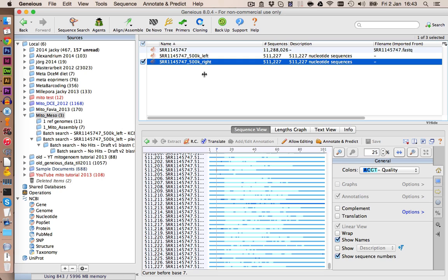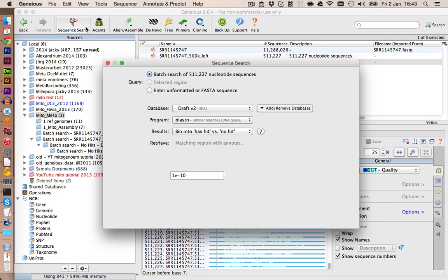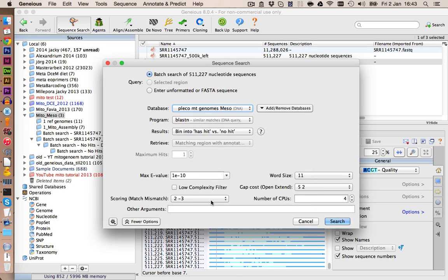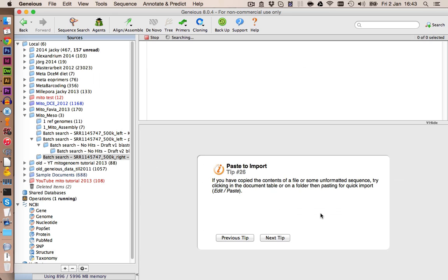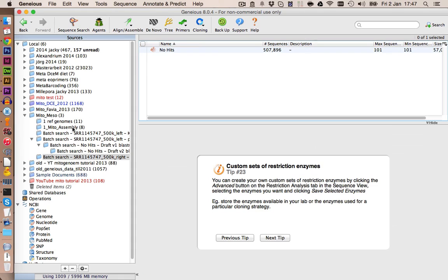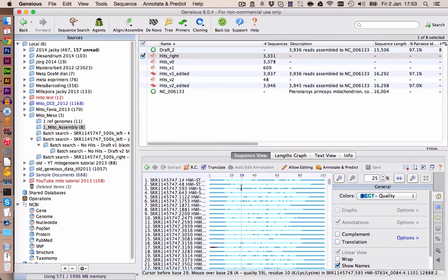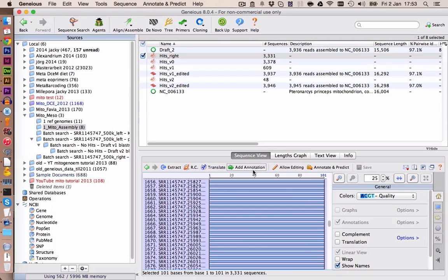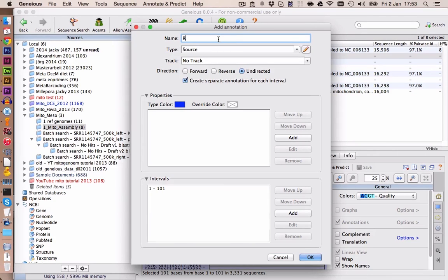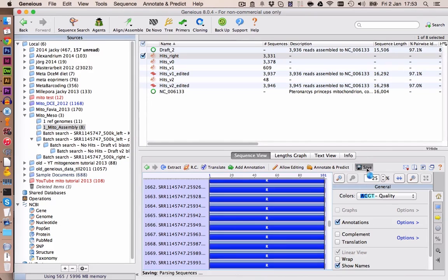We're going to click on the right one, and we go on sequence search, and we select Pleco mitochondrial genomes. The settings can stay the same. The BLAST search is done, and we have here our hits, around 3000 sequences, and we're going to rename this document to hits right. Let's also move it into our Mito assembly folder. Let's also add some annotations onto those sequences. We again press Command A, add annotation, and we name this one R for right side. You can click on Save.